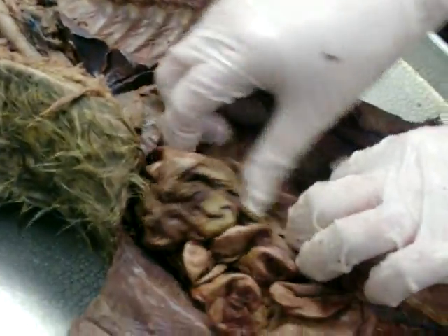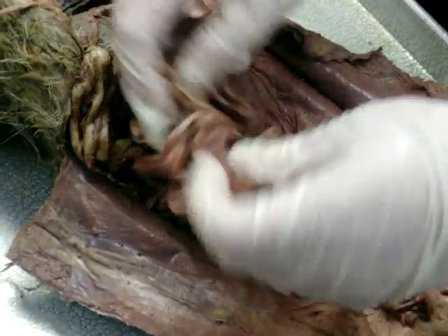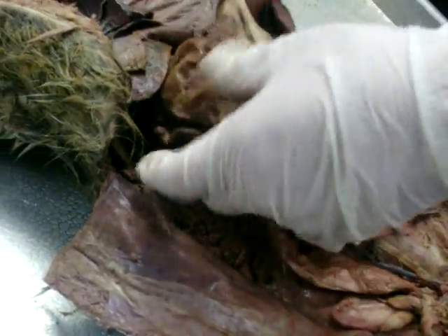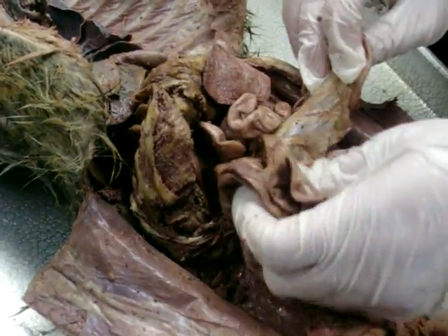Okay. Let me see. So what about this stuff that's attached to the stomach? This membrane with all this gooey white stuff. No. This fatty stuff. The greater omentum, right? Yeah. Be sure not to mix up the mesentery and the greater omentum. What's the mesentery? The mesentery is this membrane that holds the small intestines together, and when I let it go, it's what keeps them folded in bundles. Okay, and it's vascular. Where this is not vascular, it's just fat. But if you pull up on the mesentery, you can see big arteries running through it.